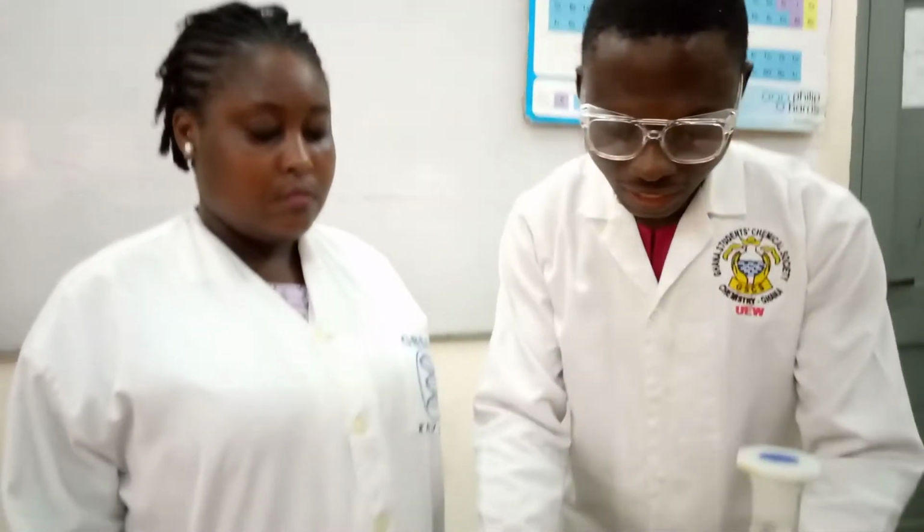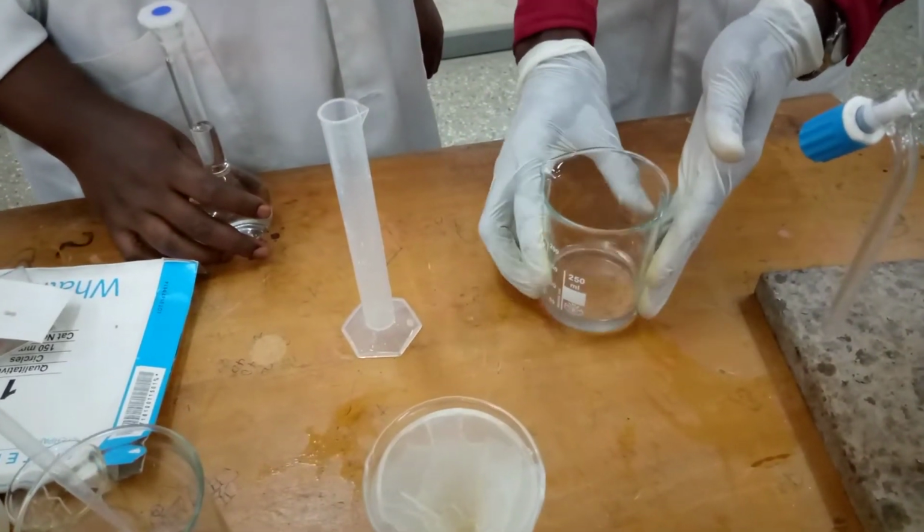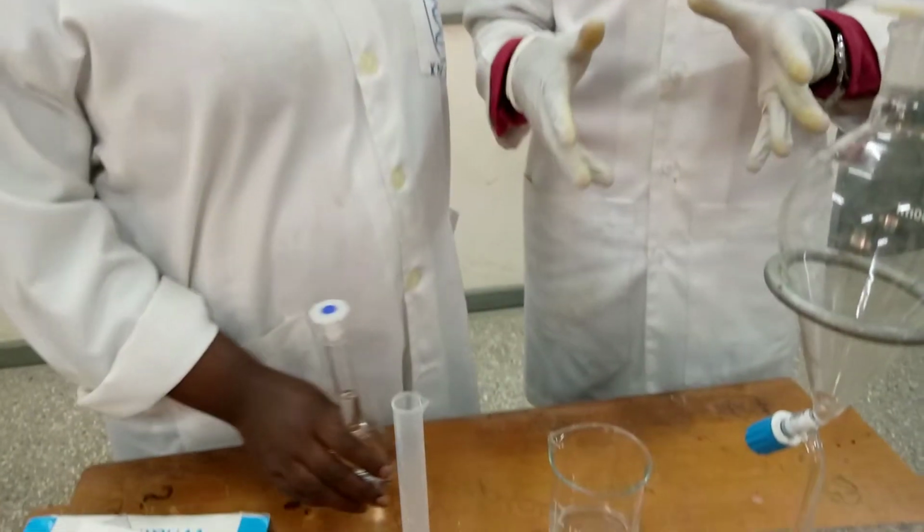So we are assuming that approximately we will use about 40 ml of the HCl to give a proton to the salt of the sodium benzoate, so that it will turn back to what? Benzoic acid. Okay. So the reason why we're adding HCl is to make sure that the sodium benzoate will be turned to what? Benzoic acid. Because that is what we need, we don't need the salt but we need what? Benzoic acid. Okay. So we are going to be adding it bit by bit.